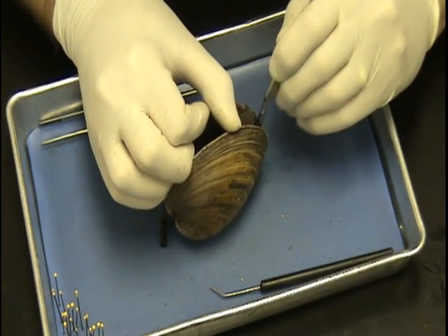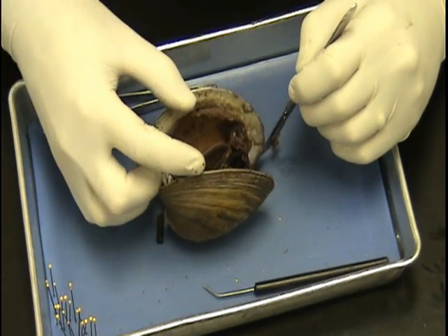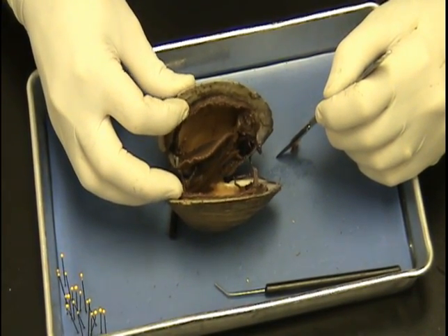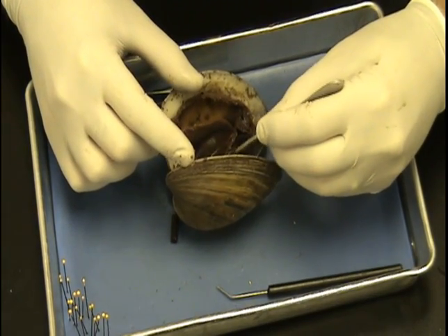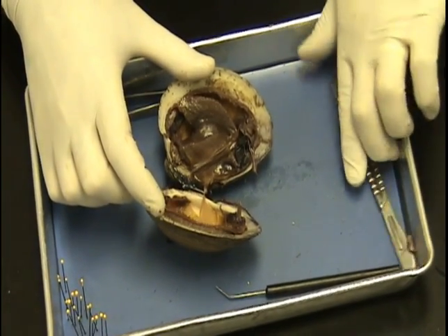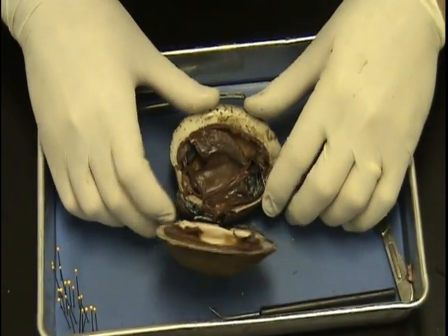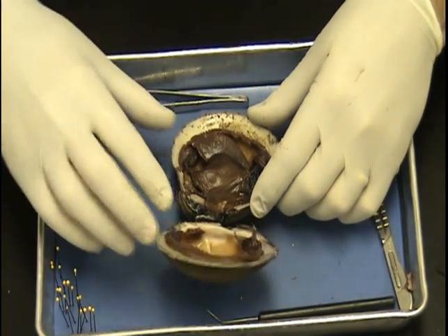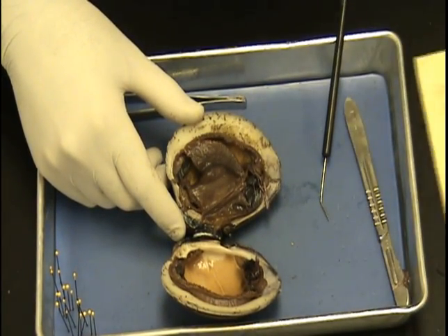There we go. I'm going to gently pry that open. As I do, I'm going to look and see which side is coming off a little easier from the tissue from the valve — and it looks like I'm going to go with this side. So I'm going to cut that right there, let that lay open, put that down and away and open that up. Now let's go through some of those anatomical parts. I'm going to need to get my list to make sure we cover everything, but let's take a look at them one by one.